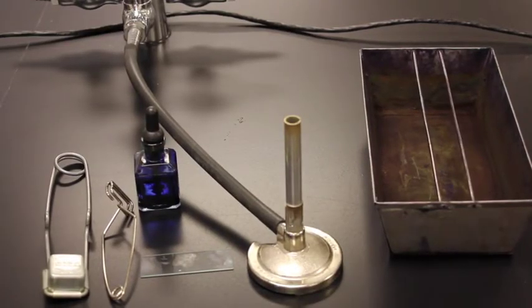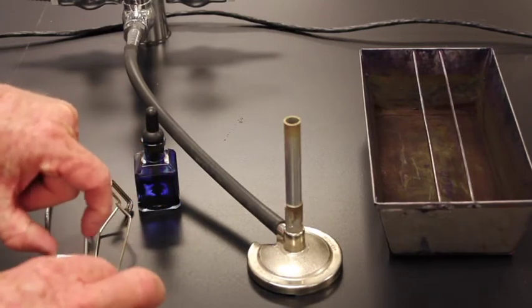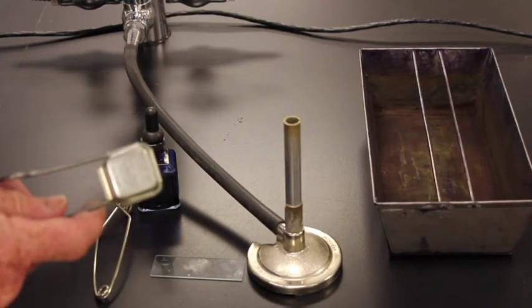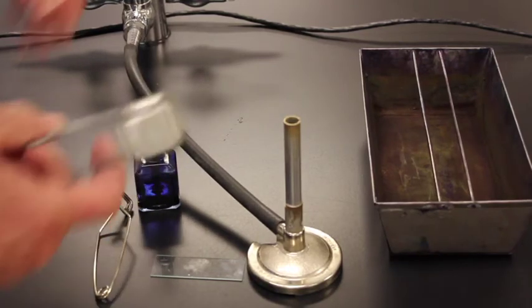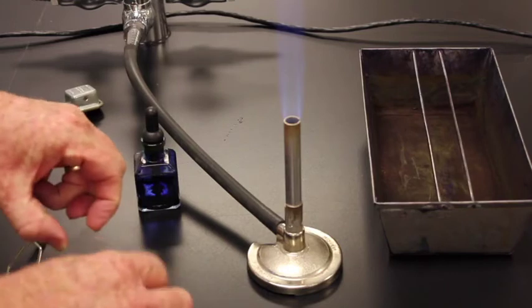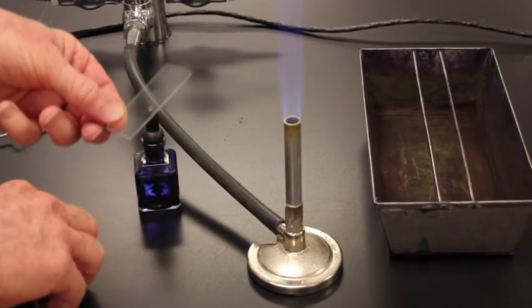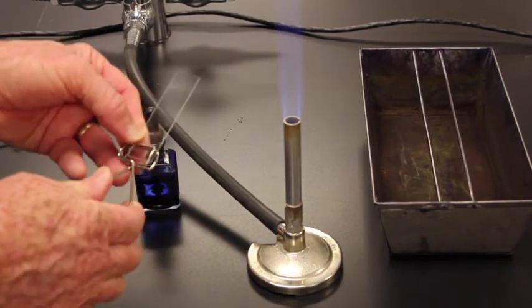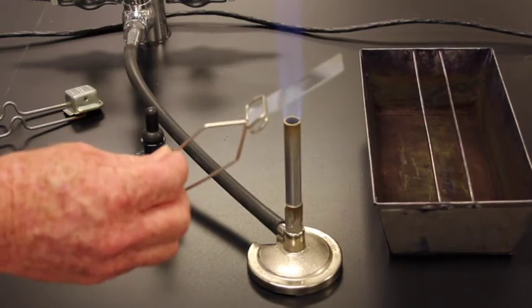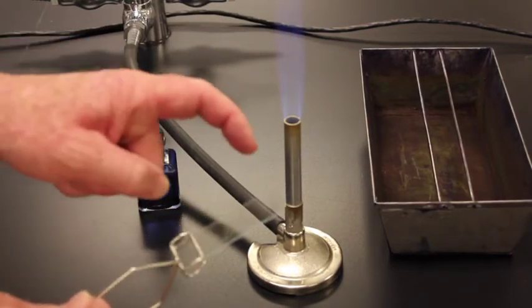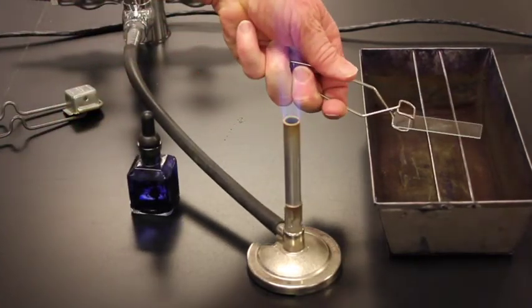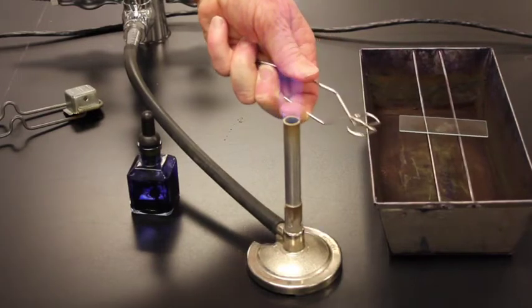Now to complete my smear preparation. Here's my smear preparation. It is dry now. So I'm going to relight my Bunsen burner. Where I barely get that gas. Get that going. And now what I want to do is take my slide and I want to fix the bacteria. So we're doing what's called heat fixation. I basically take this slide, angle it away, and just go over one one thousand, one one thousand, and that's all I do. Do not touch the end of this because that's hot now. And so then I'll just go over here and place that on the staining tray.